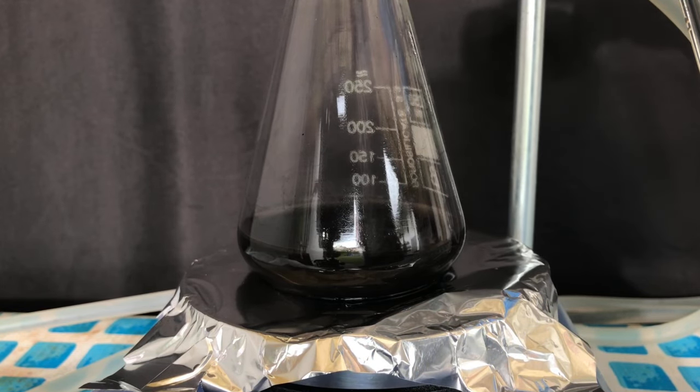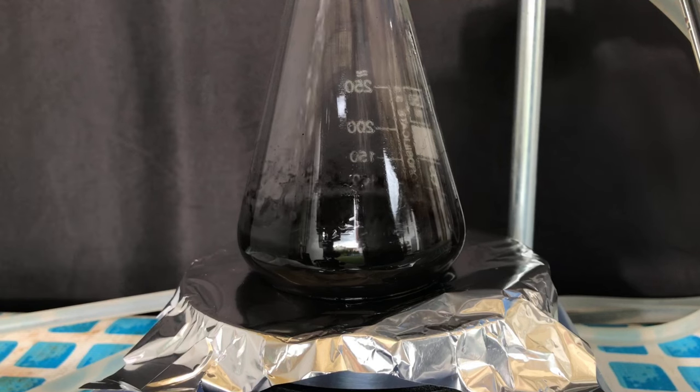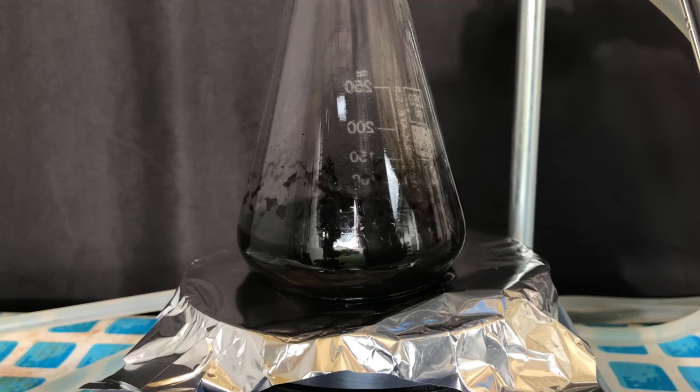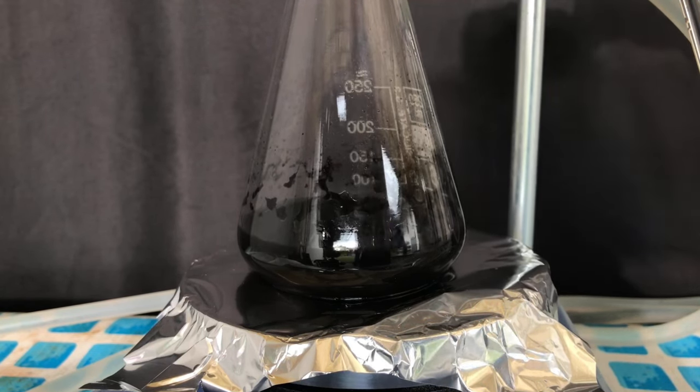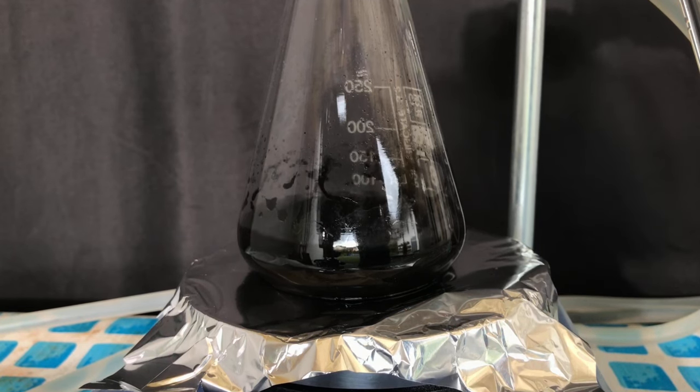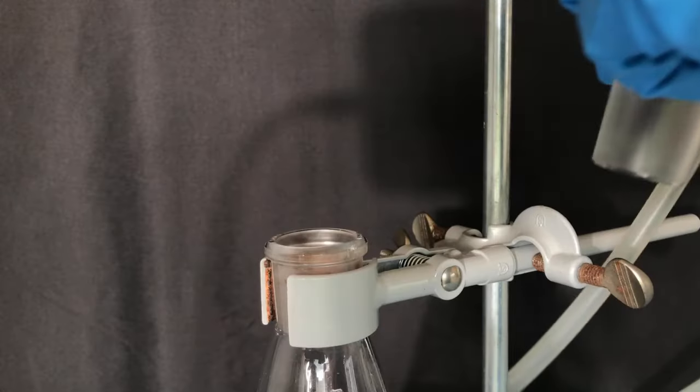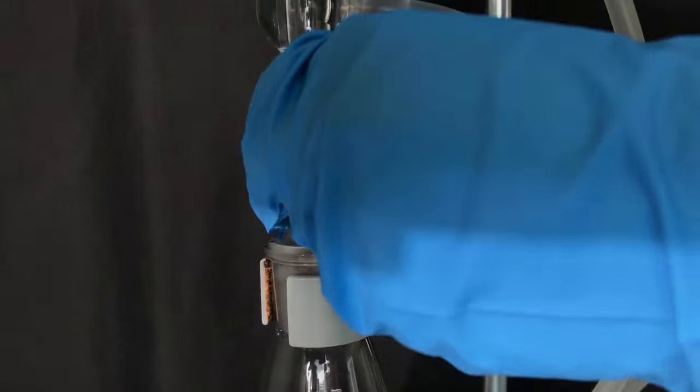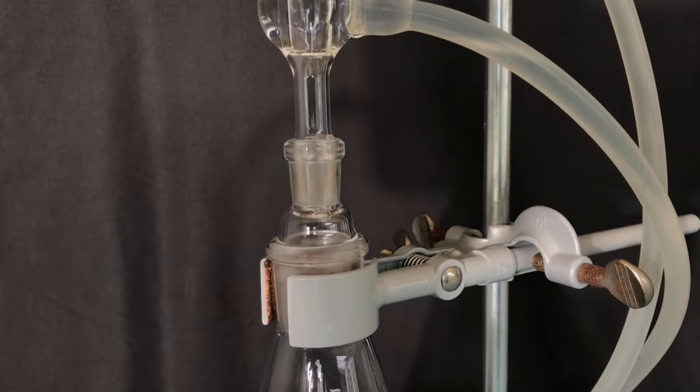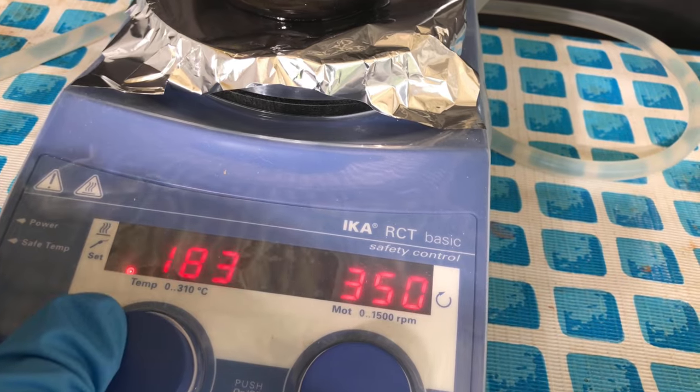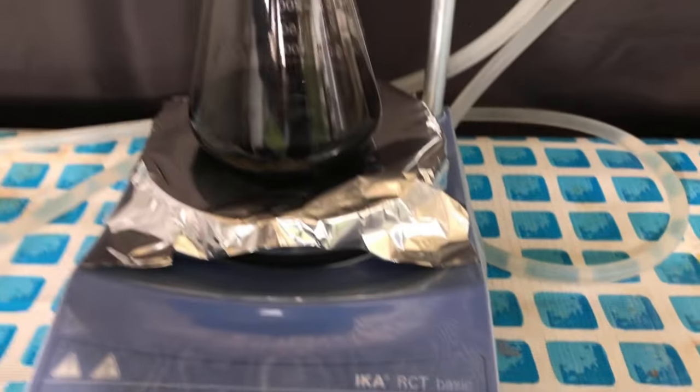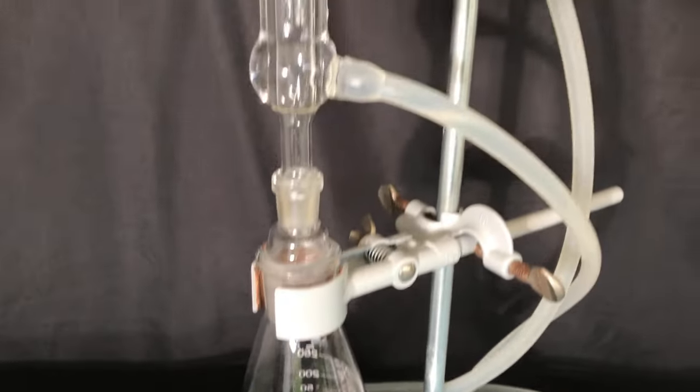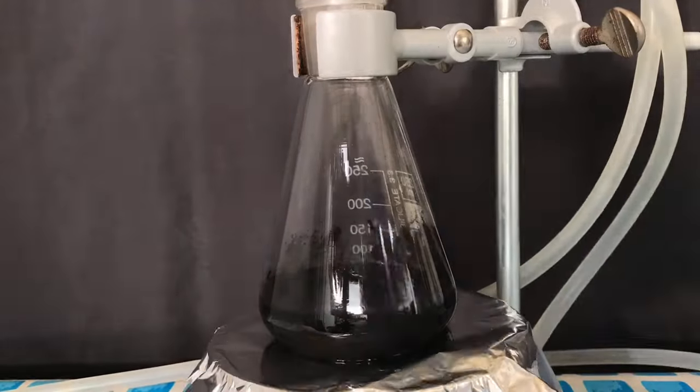With concentrated hydrochloric acid, copper oxide would react instantaneously. With acetic acid, this sadly is not the case. To avoid having to wait for days, we are going to use a simple trick. We will have to heat it, but to speed up the heating process even more, a reflux condenser will be placed on top of it so no vapors are going to escape. By doing this, we don't have to worry about acetic acid leaving the apparatus while the solution is boiling hot.